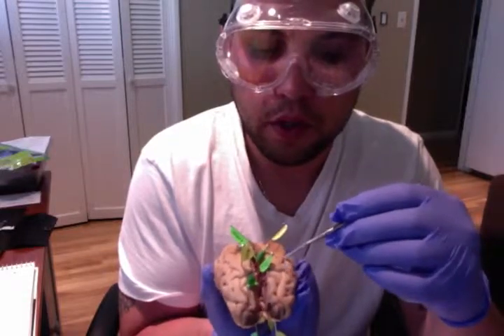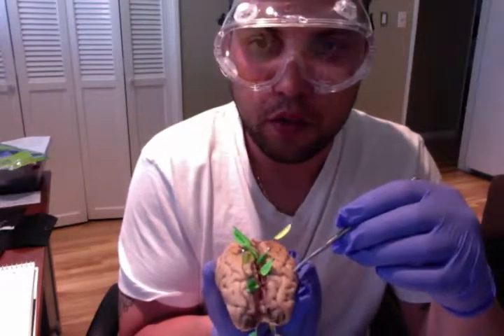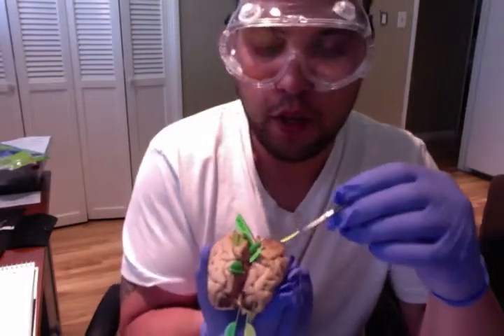We have also the sulcus. Major structural features of the brain are the grooves and ridges that give the brain its surface texture. The deeper the sulcus, the more we want to refer to them as fissures. Furthermore, the sulcus help divide the brain into the four different lobes.